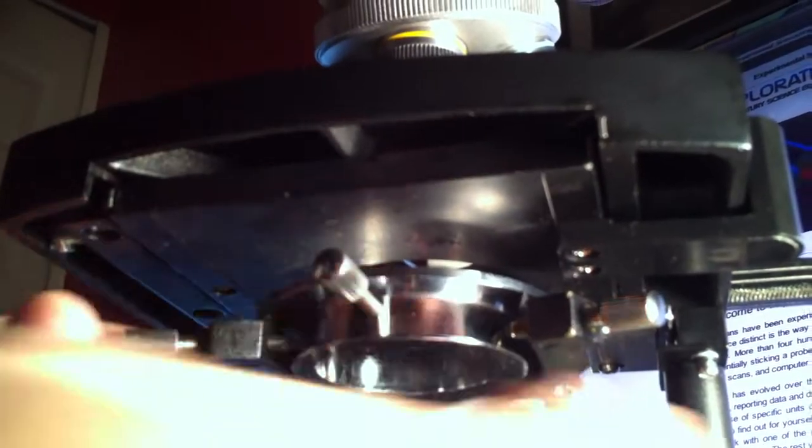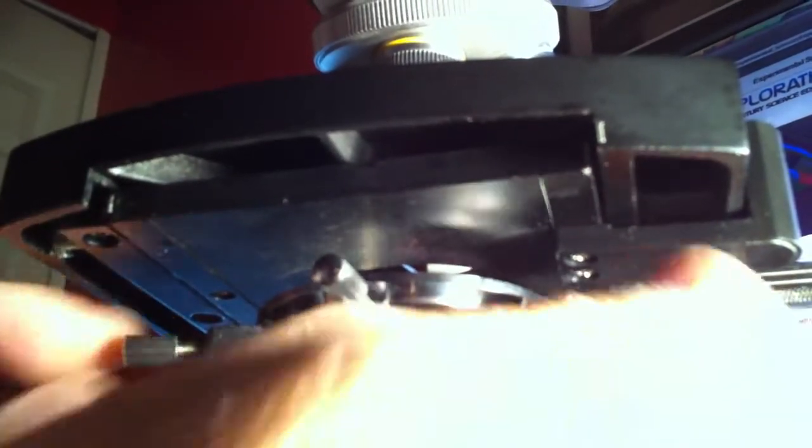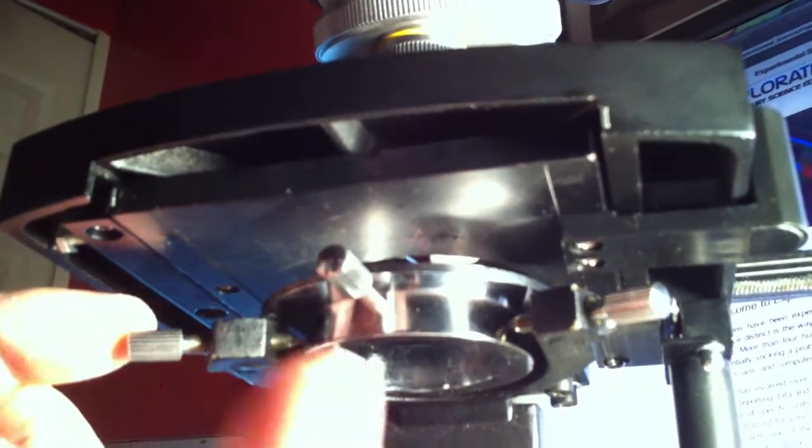just simply put the ring assembly back, tighten the screws like this. Sometimes it'll come out with the sub-stage condenser attached to it. So first of all, just discover whether or not the whole ring assembly came apart or if just the sub-stage condenser came out.